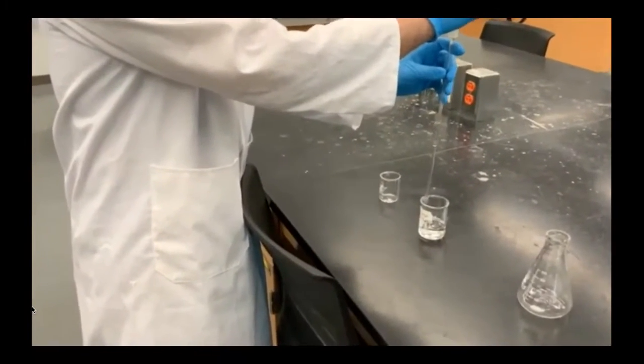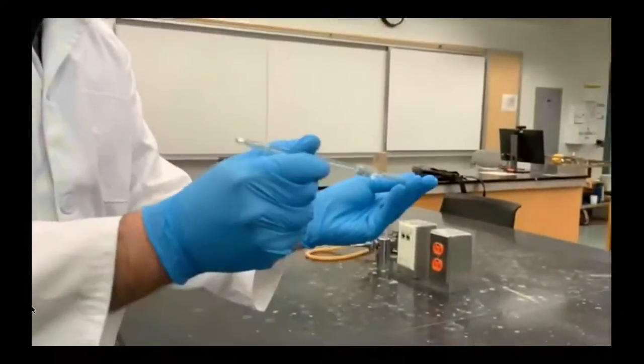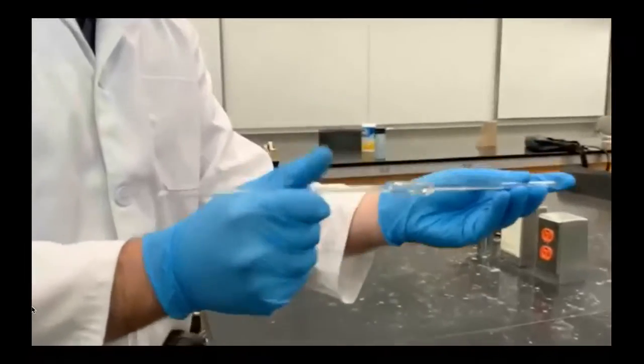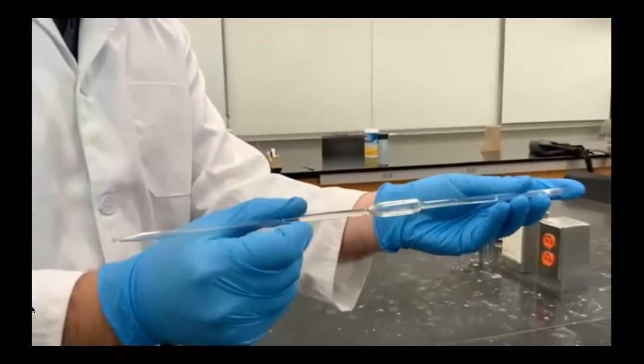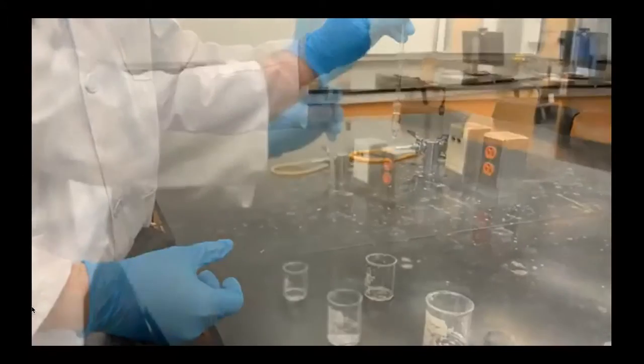Then we're going to rinse the pipette by drawing up some water and rinsing it out. We'll repeat that process with some of the vinegar.